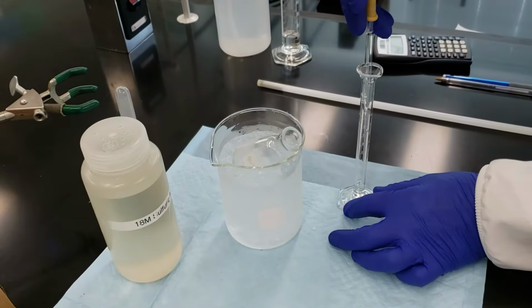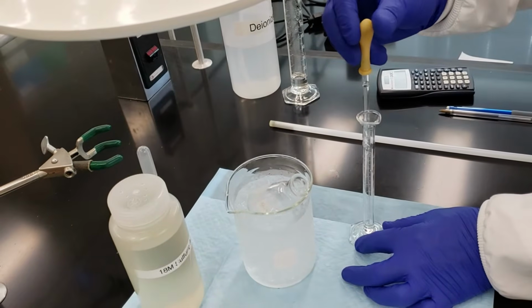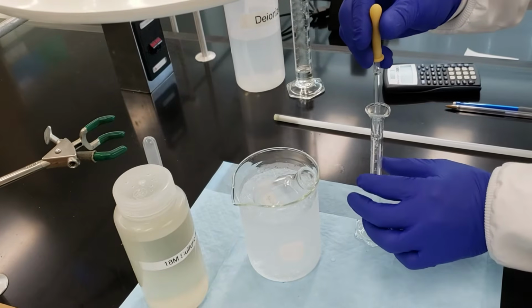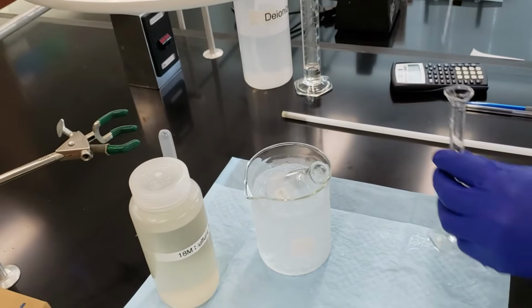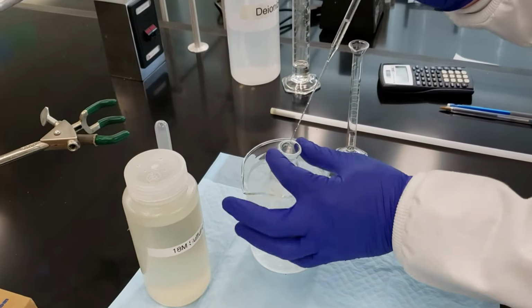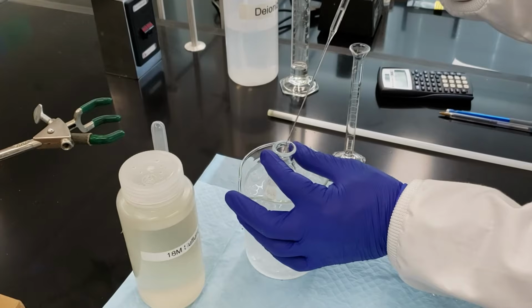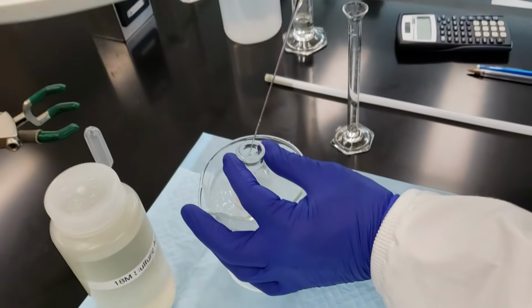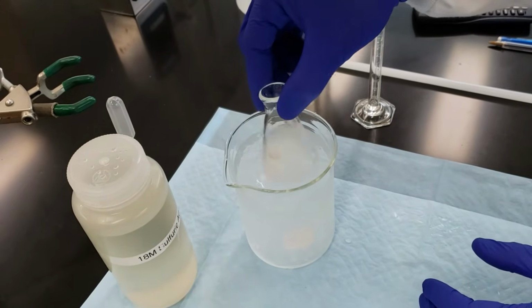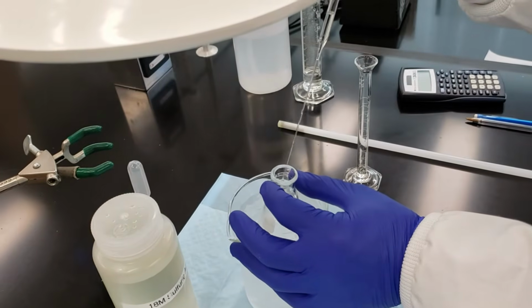This is an exothermic reaction, like a number of the reactions that we've seen in our past videos. We just want to make sure that it doesn't overheat. So we'll do this slowly and on our ice bath, and we'll move it over to our hot plate. And I'll do a couple of drops, and I'll make sure I stir it, and we'll just proceed cautiously.